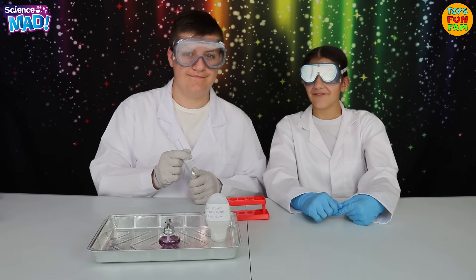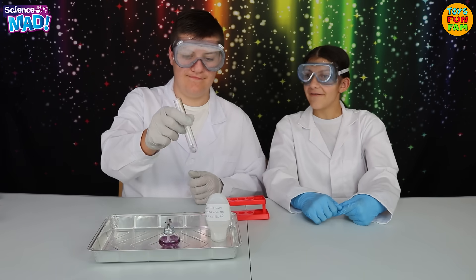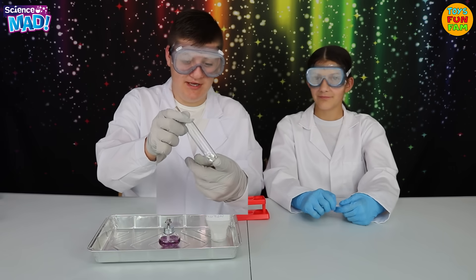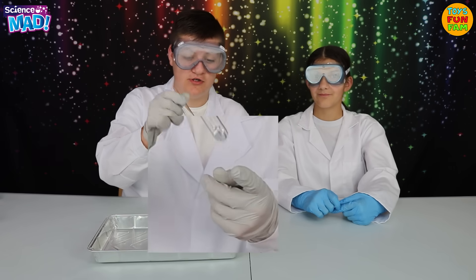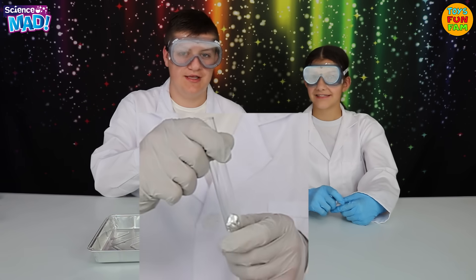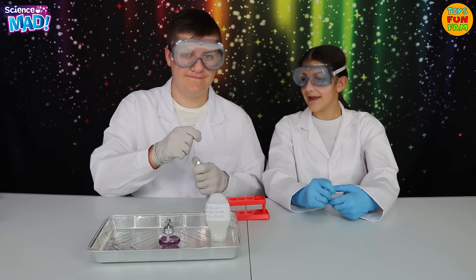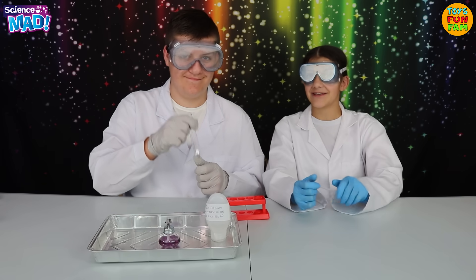For this experiment we're going to see the reaction of aluminium with sodium hydroxide. We've got two centimetre square of aluminium foil cut up into smaller pieces inside the test tube. I'm going to add two centimetres of the sodium hydroxide that we made earlier into the test tube.